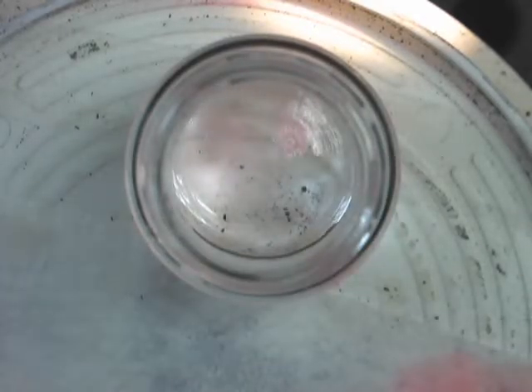The same experiment has been recorded from the top view to give viewers a better angle. Here is the oil dropped in the water. And now, the oil is shaken. After some time, one can see the emulsion, which is colorized.